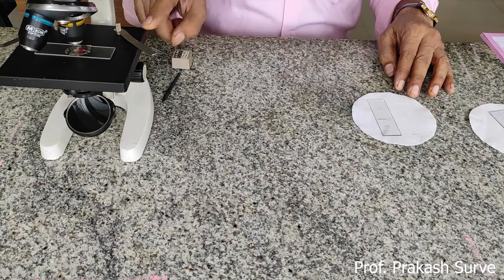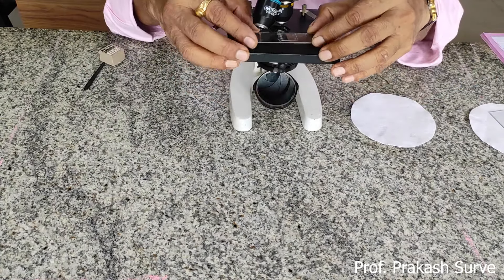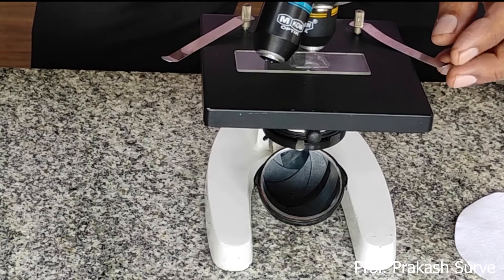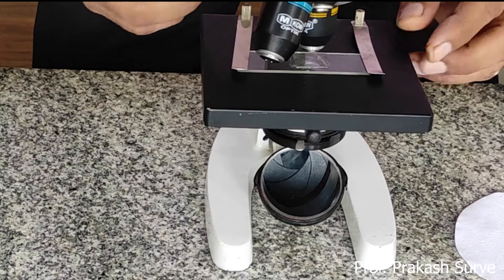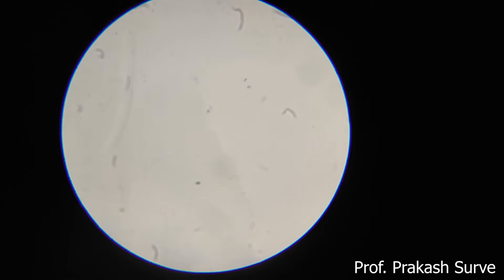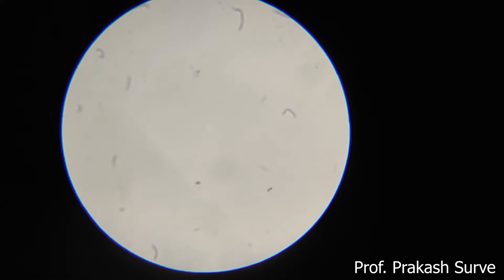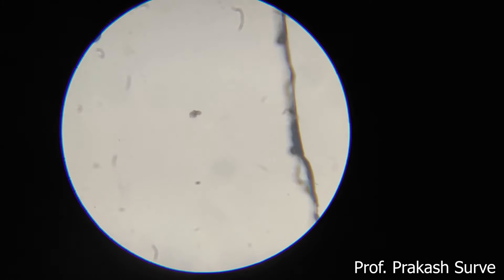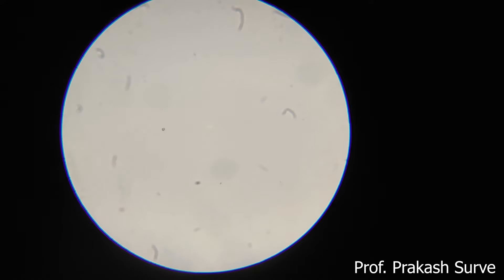First, I will take the slide prepared from the washed leaf and view it under the compound microscope. Place it on the stage under the objective and look through the eyepiece. Adjust the distance using the rough adjustment screw first, then fine-tune with the fine adjustment screw. Fix the slide position with the clip. Under the microscope, the washed leaf slide shows only rarely any particles — perhaps one or two fibers — confirming it is clean.